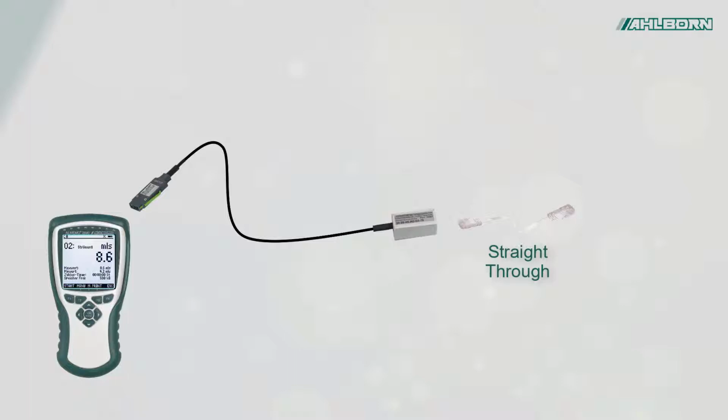Using a standard patch cable, we can connect the ALMEMO device directly to the Internet via an Internet router to retrieve data or to remotely control the device. We make sure that the IP address stored in the ALMEMO Ethernet data cable is within the address range of the Internet router.